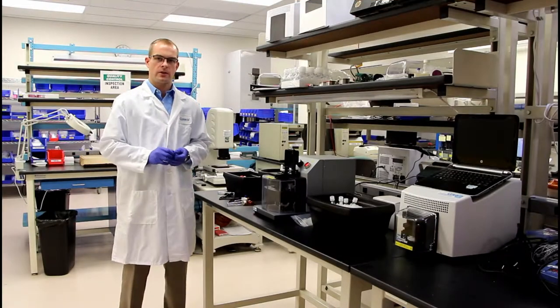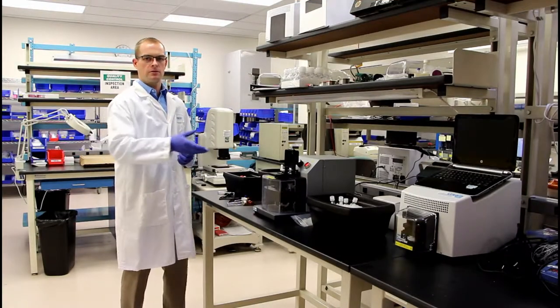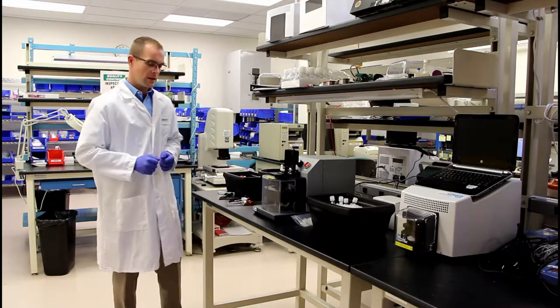Hello, my name is Dave Dao with Covaris. I'll be walking you through how to use the Covaris Cryoprep CP02 today.